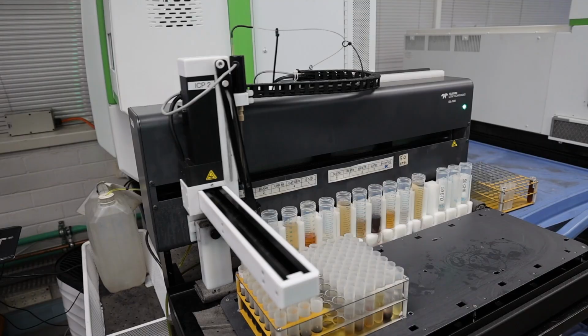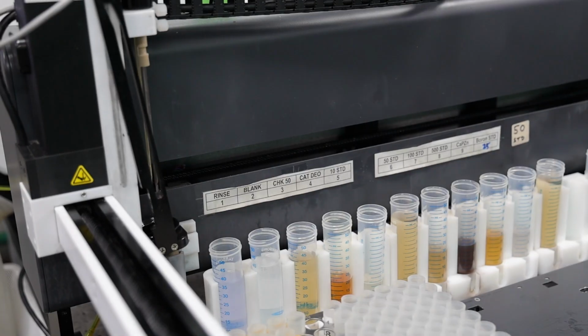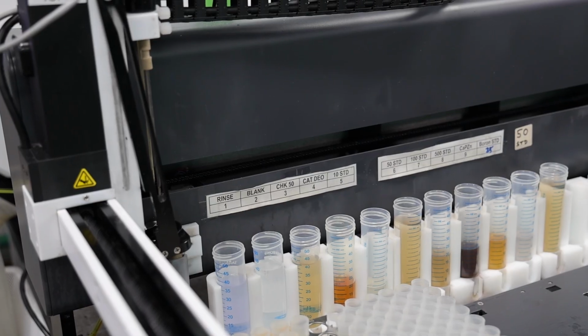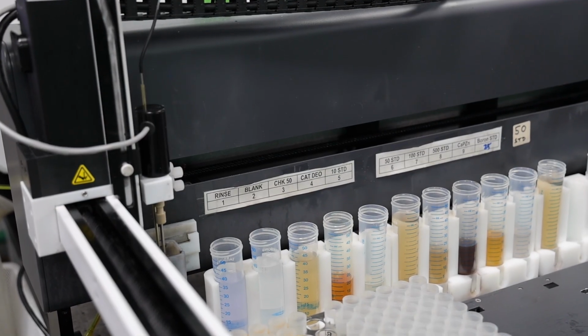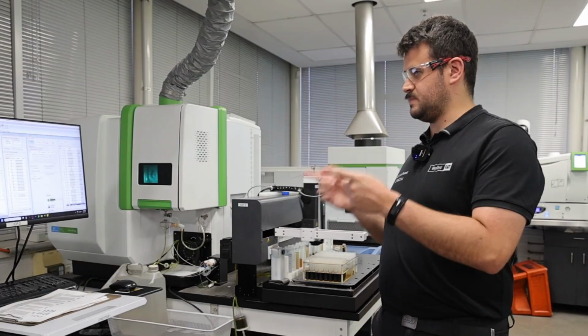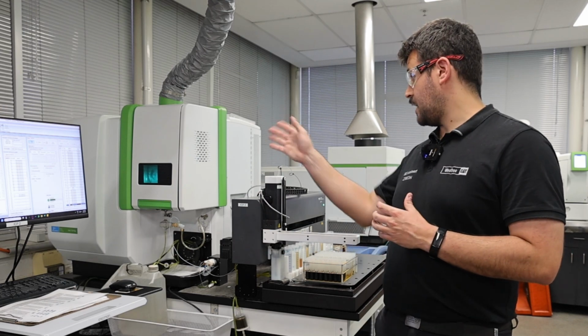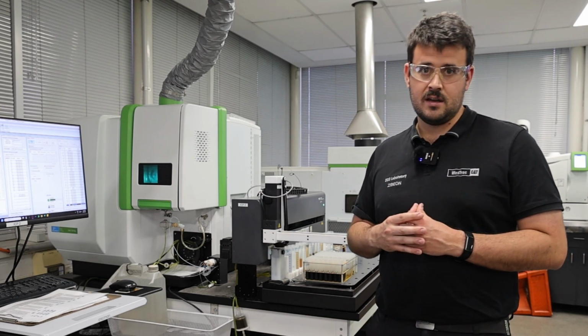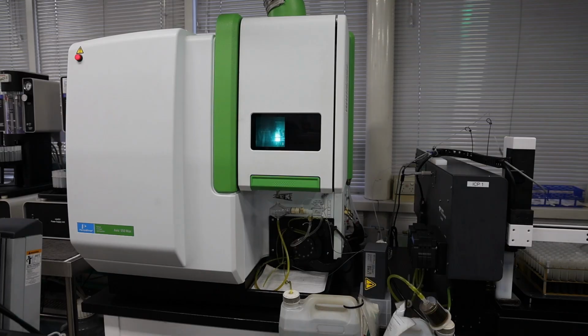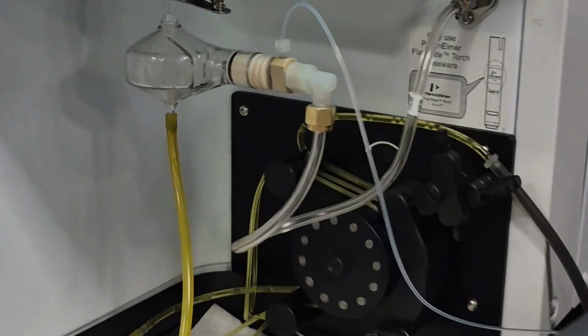When it hits that flame, all of that energy from that flame breaks down your oil sample into its basic atomic elements. The energy it then absorbs in those elements is released as characteristic, unique wavelengths of light that are specific to certain elements. Those wavelengths are then detected by a detector in our unit here, and based on the intensity of the light generated at those wavelengths, it can then calculate the concentration of those elements.